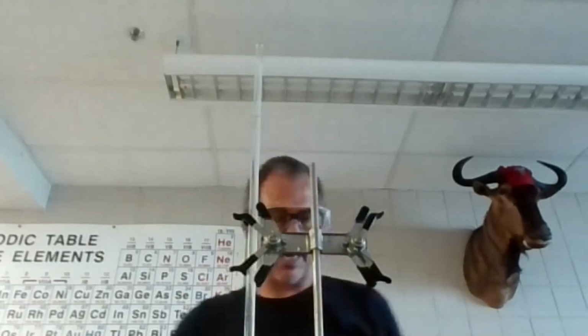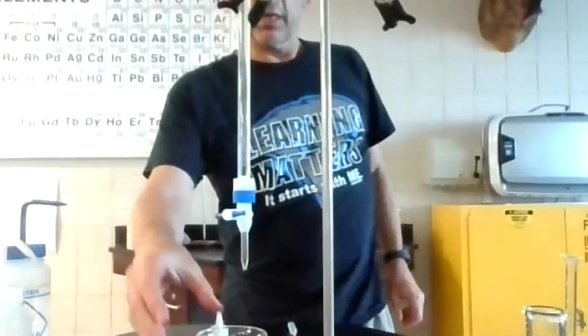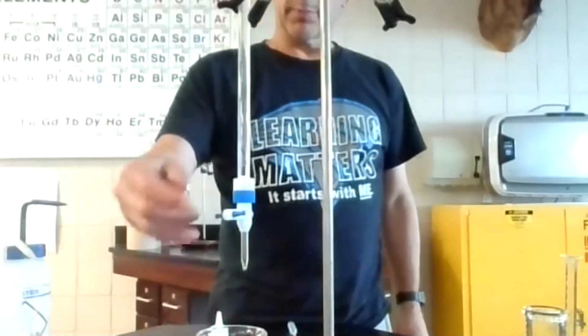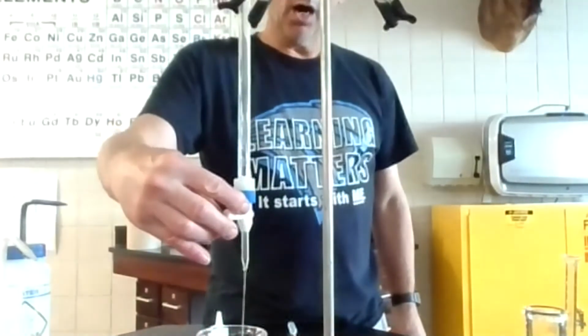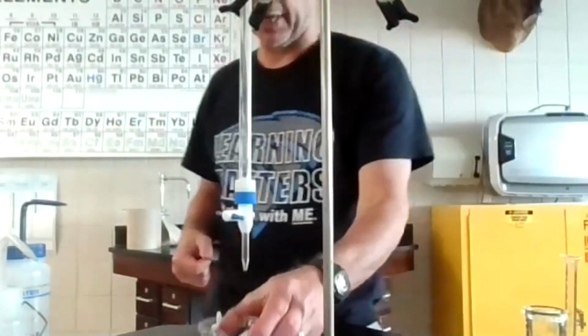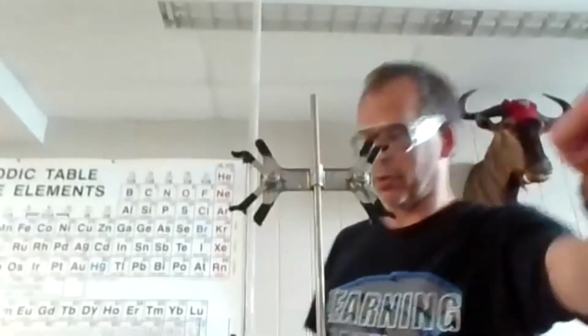Now, before reading that, I'm going to grab a different beaker right here. And with this beaker, there's usually air when you fill an empty burette. So I got to get rid of that air. So I'm going to burp the burette. Okay, and you could hear that air coming out, just like a baby when it's got air in its tummy. So you burp the burette, get those air bubbles out, otherwise they will cause errors.